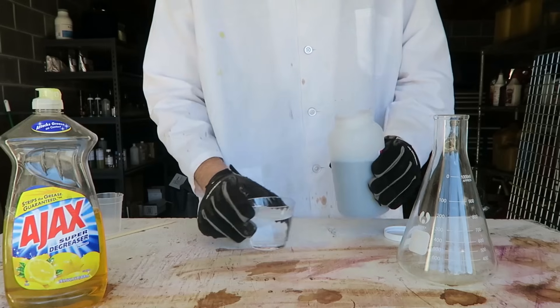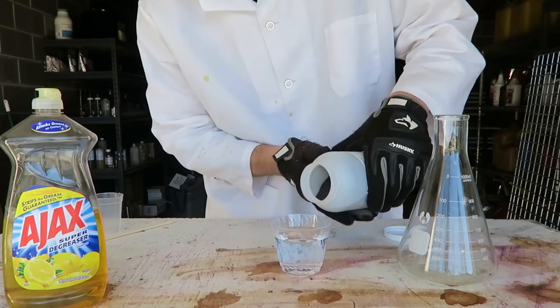What's up everybody, welcome back to my laboratory where safety is number one priority. Today's experiment I'm gonna show you another way to make elephant toothpaste with potassium permanganate and 35% hydrogen peroxide. It's awesome, it's way different, but it looks so awesome. So let's get to it.